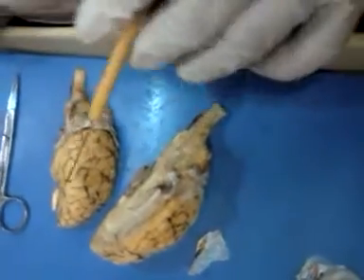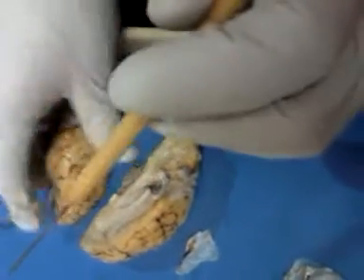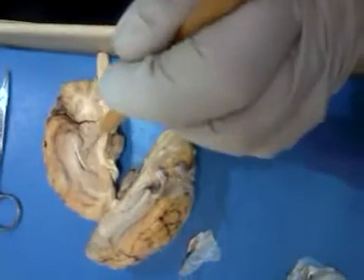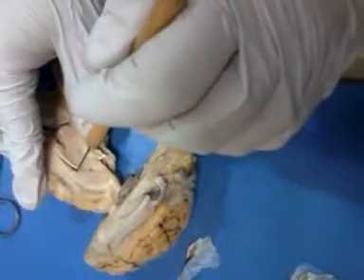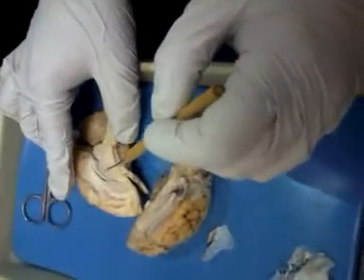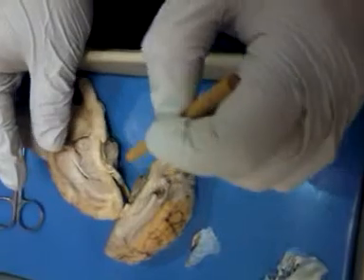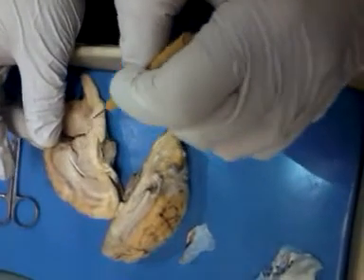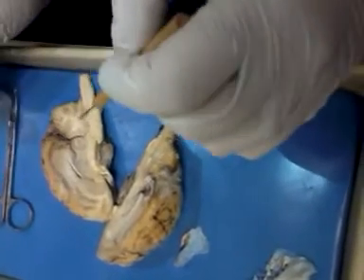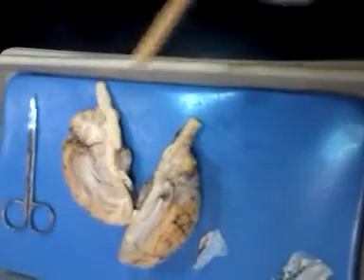So they're going to do probably frontal, cerebellum, and then, like I said, they'll turn it over and you will have multiples of these. But expect lateral ventricle, septum pellucidum, corpus callosum, thalamus or hypothalamus, pituitary, optic chiasma, cerebral aqueduct, fourth ventricle, that arbor vitae. Learn it, live it, love it.